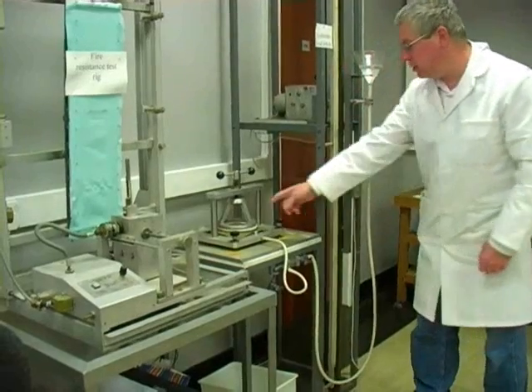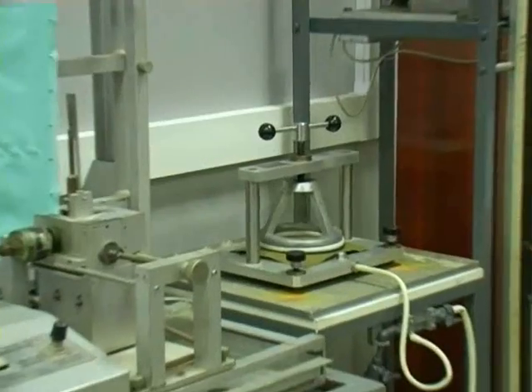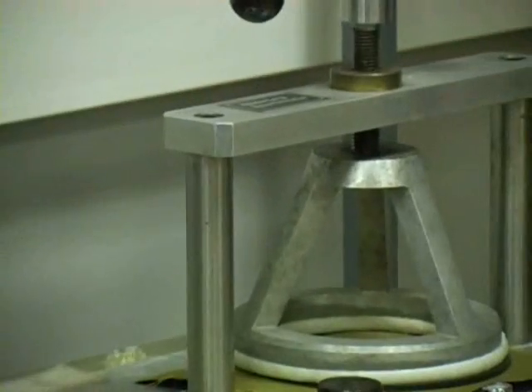And I've got three droplets on the back of there now. So I've stopped the motor, and that's telling us that's about 62 centimeters.